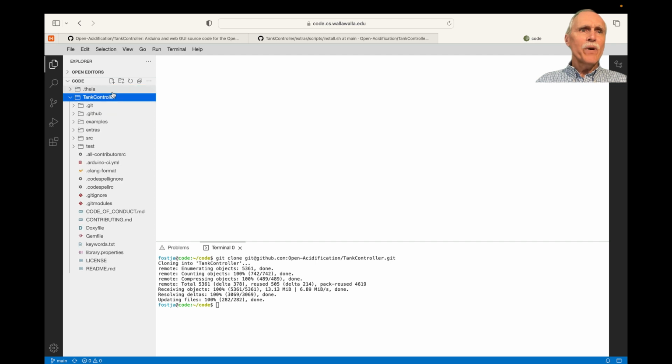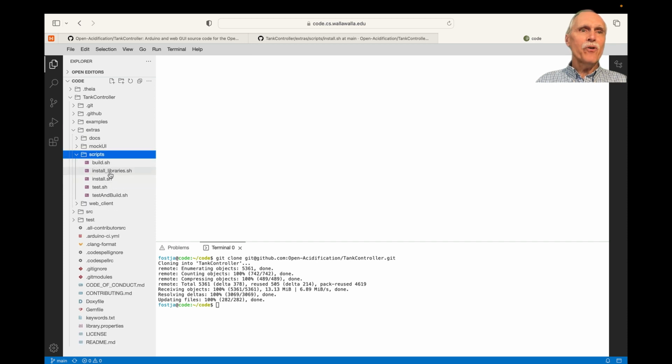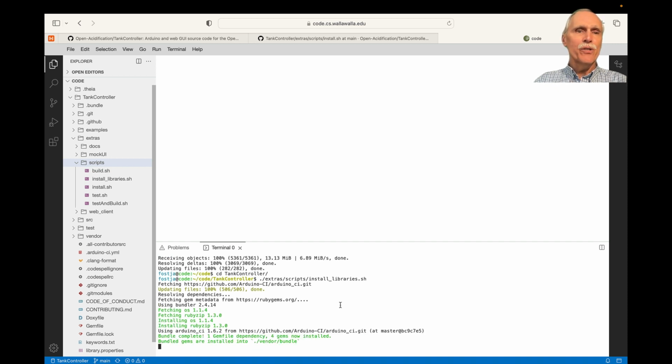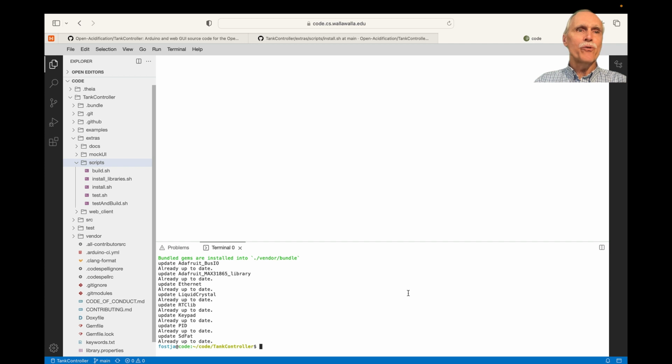Looking at the directory, we see examples, extras, source, and test. Within the extras, there's a script for install libraries. So I'll cd into TankController and then run the install libraries script. That will install Arduino CI, which is an automated testing framework for Arduino applications or libraries. Then we'll install 8 libraries that we also use. Once that's installed, I'm going to run the automated tests.